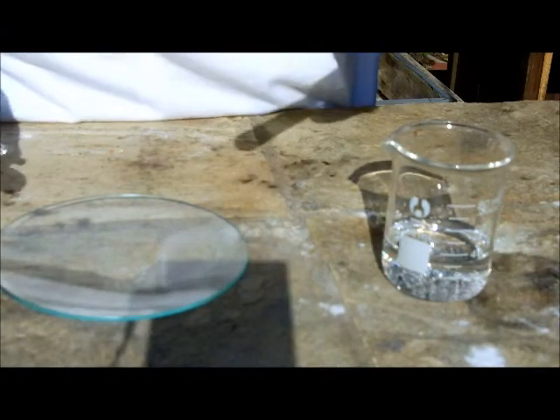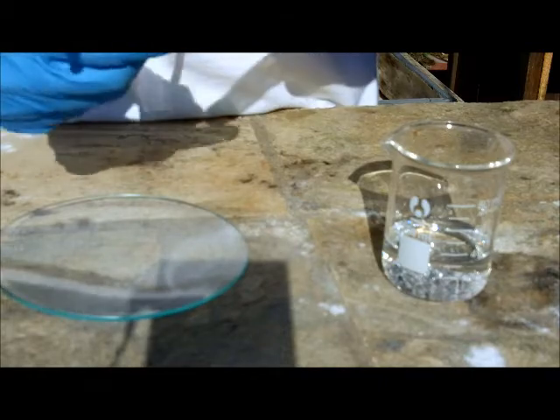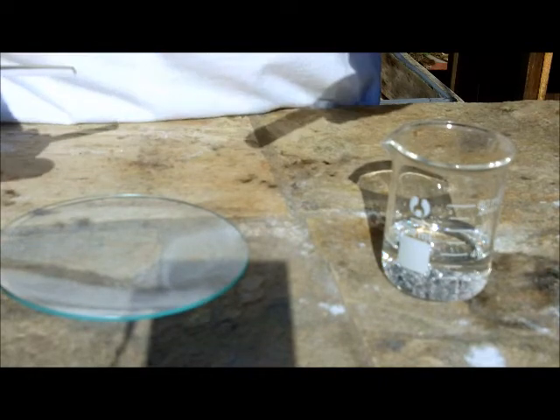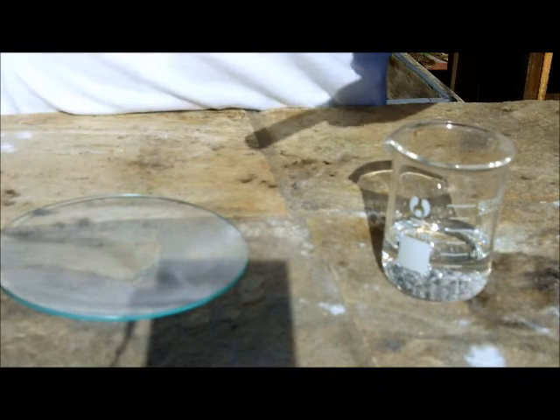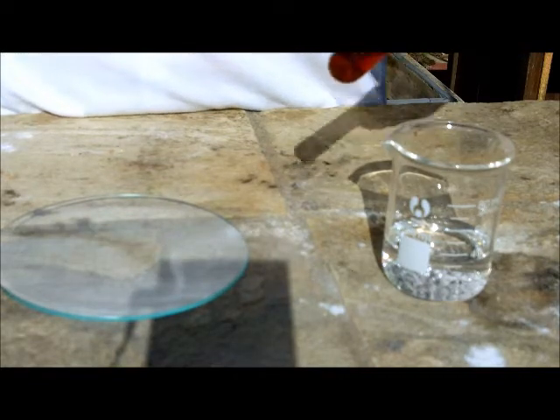Okay, once you see a significant amount of crystals form, then you can collect your product. The longer you let it crystallize out, the more product you'll collect. And I've heard about people letting it sit for days. However, just in a few hours I got most of my solution to crystallize. So that's good enough for me.